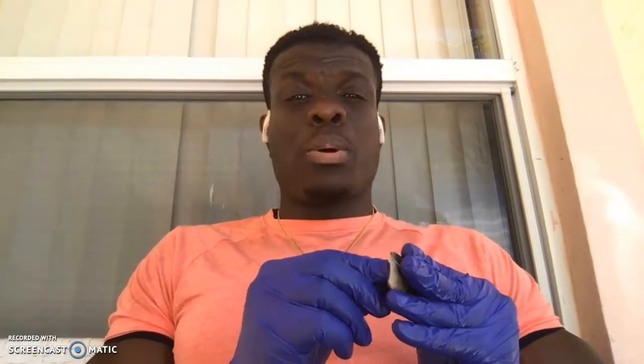A couple of the structures will be very hard to show in the video because it kind of got messed up during the dissection, like the aqueous humor. As we were cutting down, the aqueous humor started splashing everywhere, so it's hard to even show it here. But to start out, I'll start with the anterior, I believe she said anterior and posterior cavity.